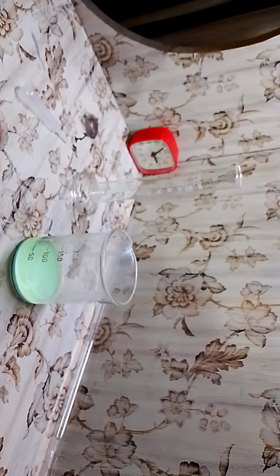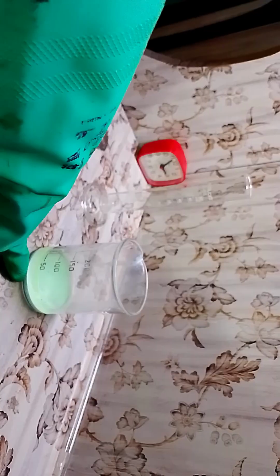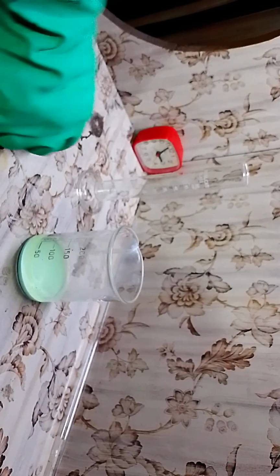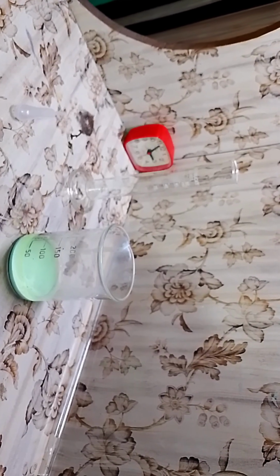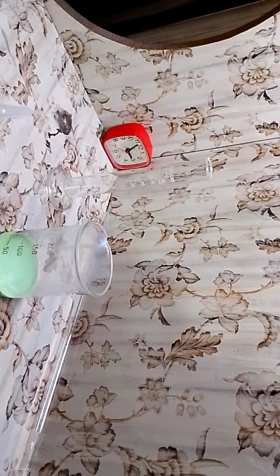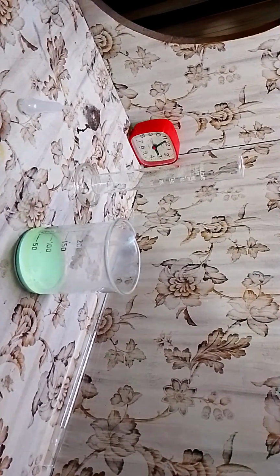I've asked the cameraman to fix the angle again. What I was saying is that you can see most of the oxalate has precipitated out. I was using tissue paper, so most of the acid got absorbed by it, so I have very little yield, but it's okay because I have done the reaction many more times in the past year, and I've got a lot of it. You can see here it's a little yellow. You can see the yellowness even in here. That's because of a little bit of extra oxalic acid.